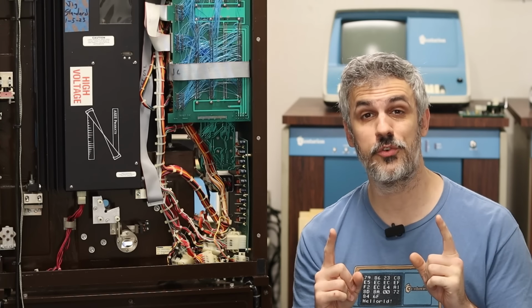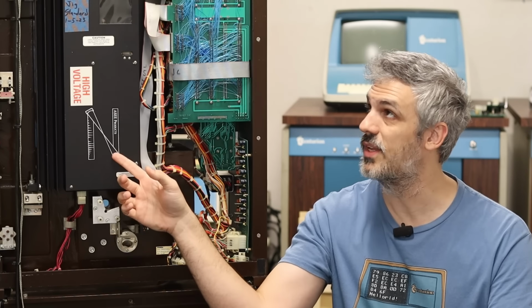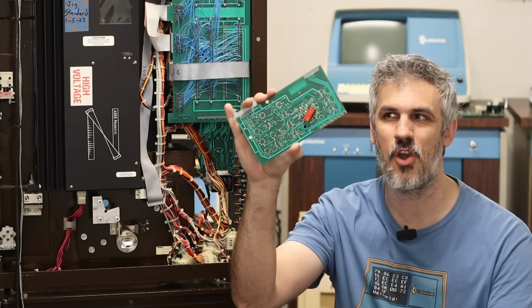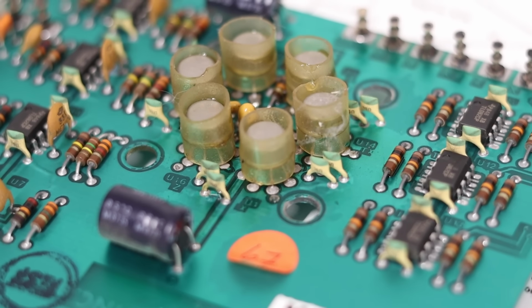And here's where things get a little tricky because we need to align the laser, but we're not going to do that by moving the laser box itself around. This is right where it needs to be. We do that by moving the sensor card around. And this sensor card has 6 sensors on it, and all 6 of them need to be perfectly aligned.